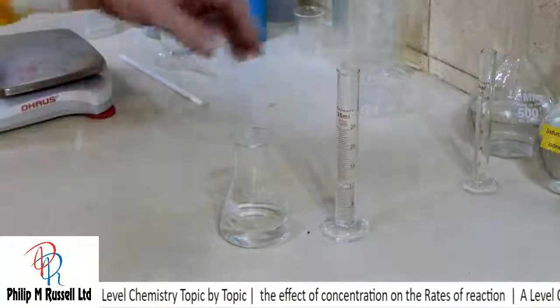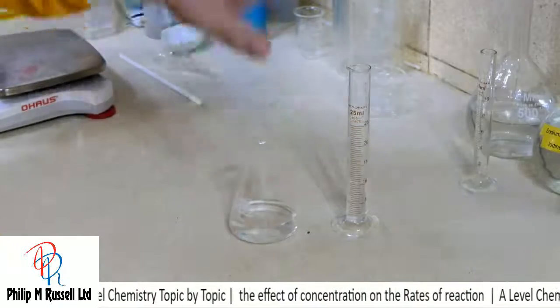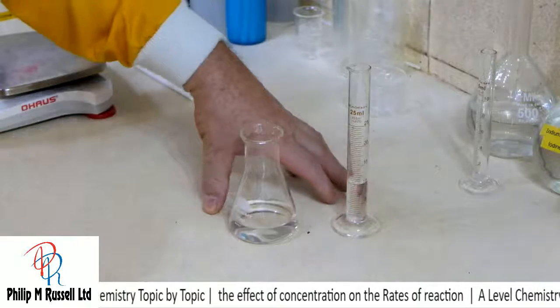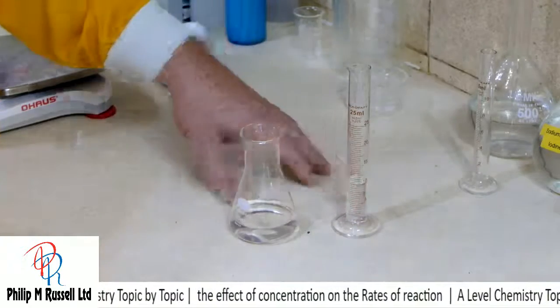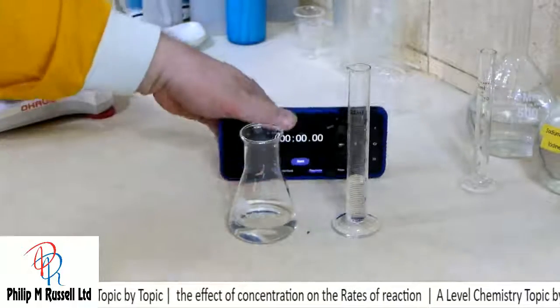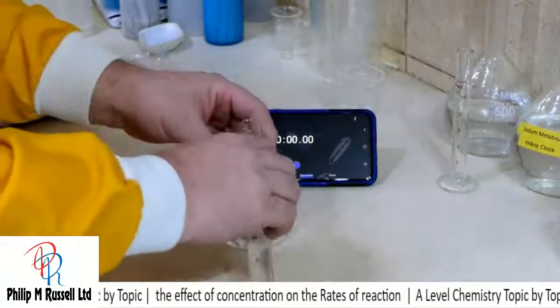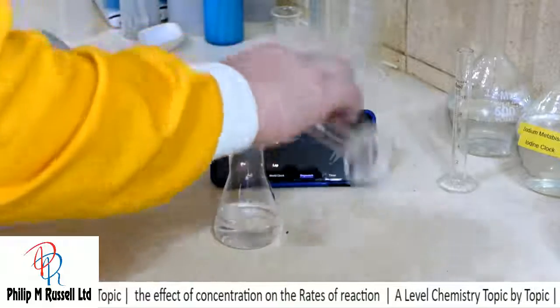So what we've got, two clear solutions. We're going to pour them together, and this is what surprises everybody. It makes just another clear solution. We've got two basic clear solutions joined together, makes a second clear. So let's pour them in and we'll start the clock.